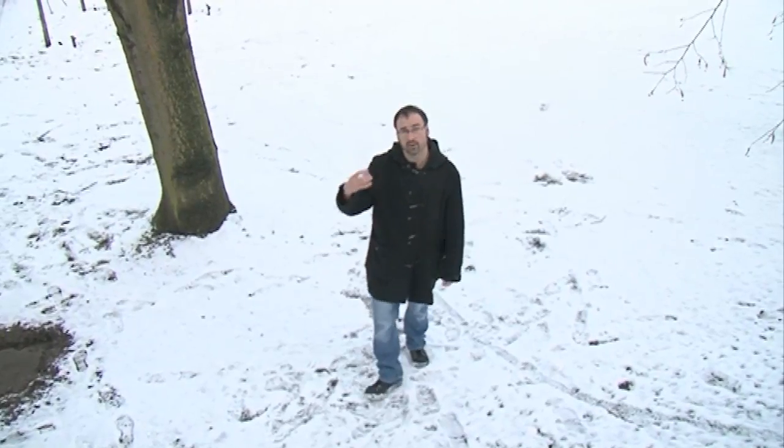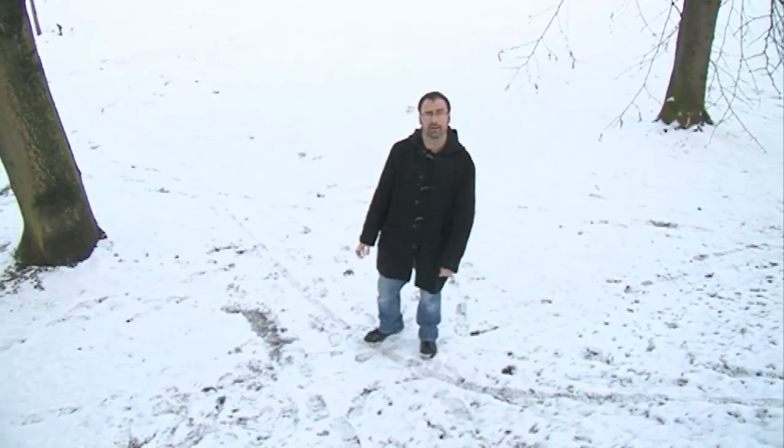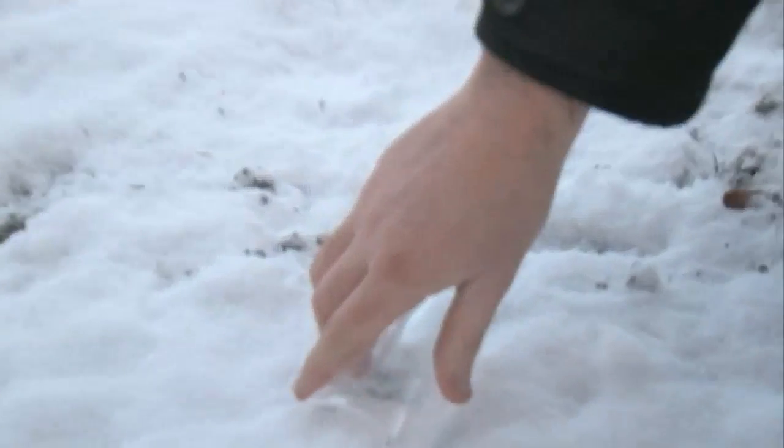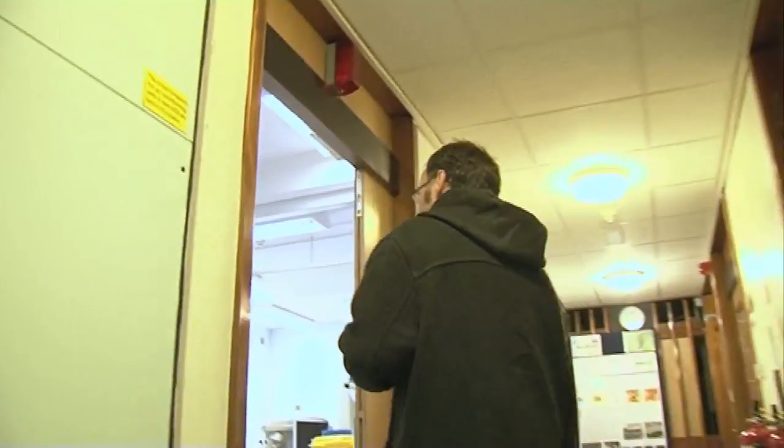What we're going to try and do is look at snow in a little bit more detail. We'll collect up a cupful of it, bring it in to our resident electron microscopist who's going to use an electron microscope to look at the fine detail and structure of the snow. It's a real shame that it's not snowing at the moment because that's by far the best. When they impact on the ground you generally lose the crystal structure.